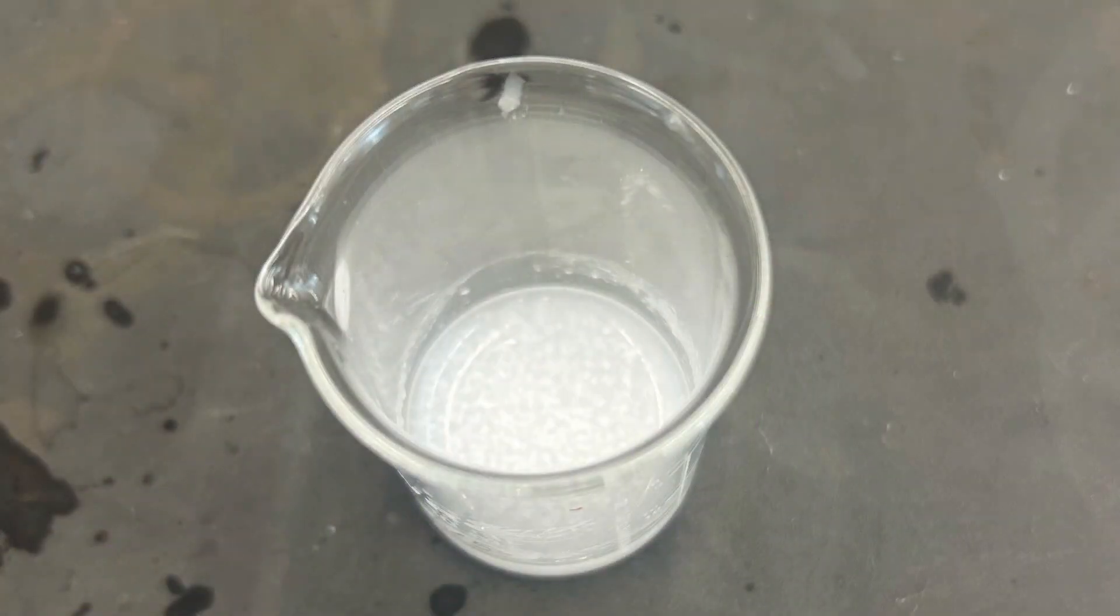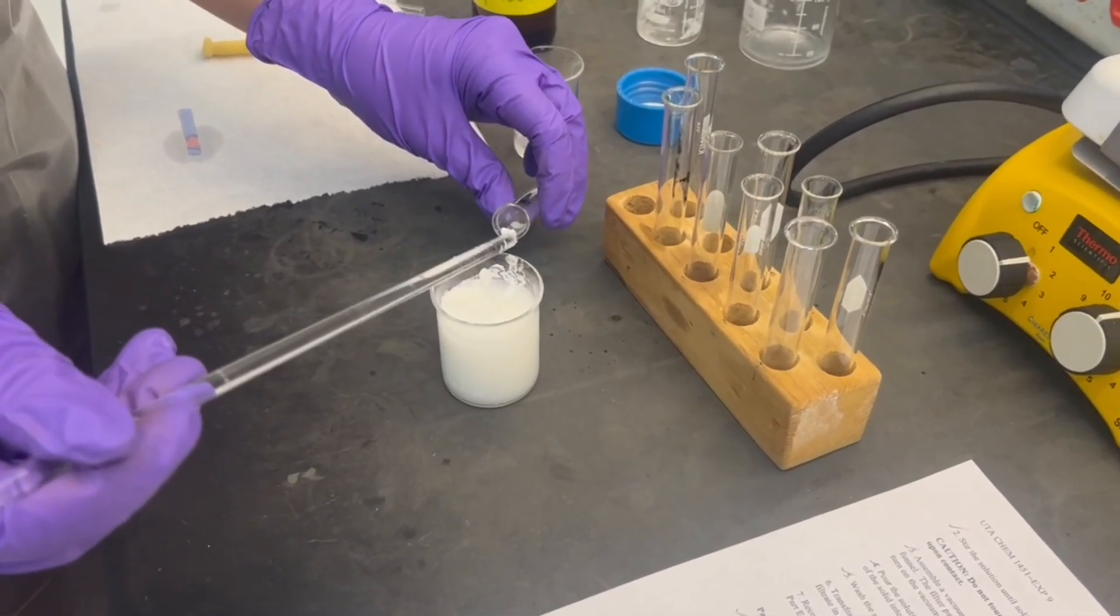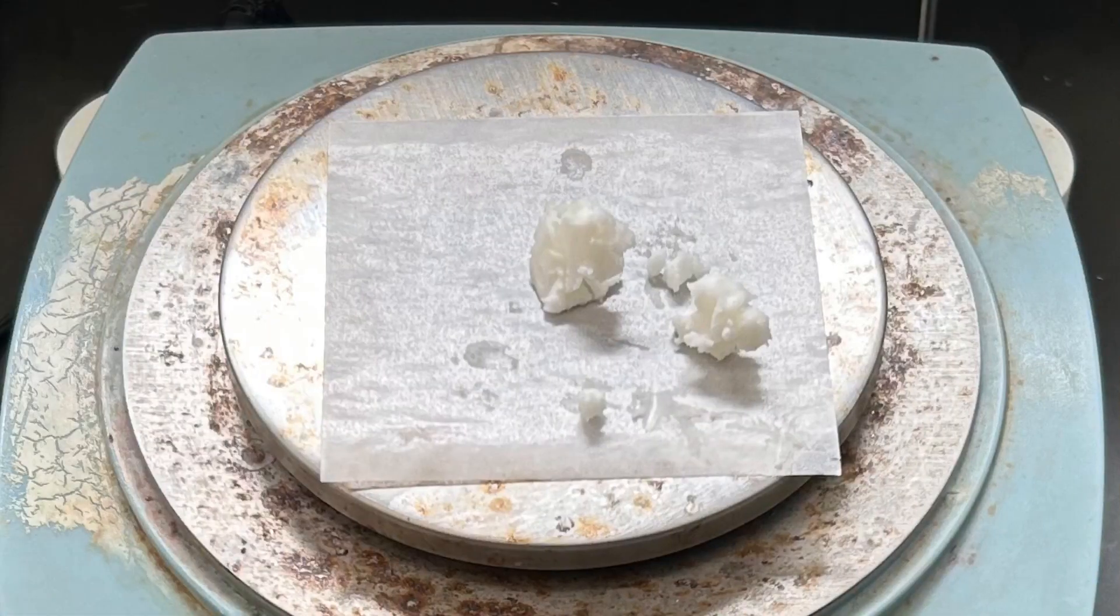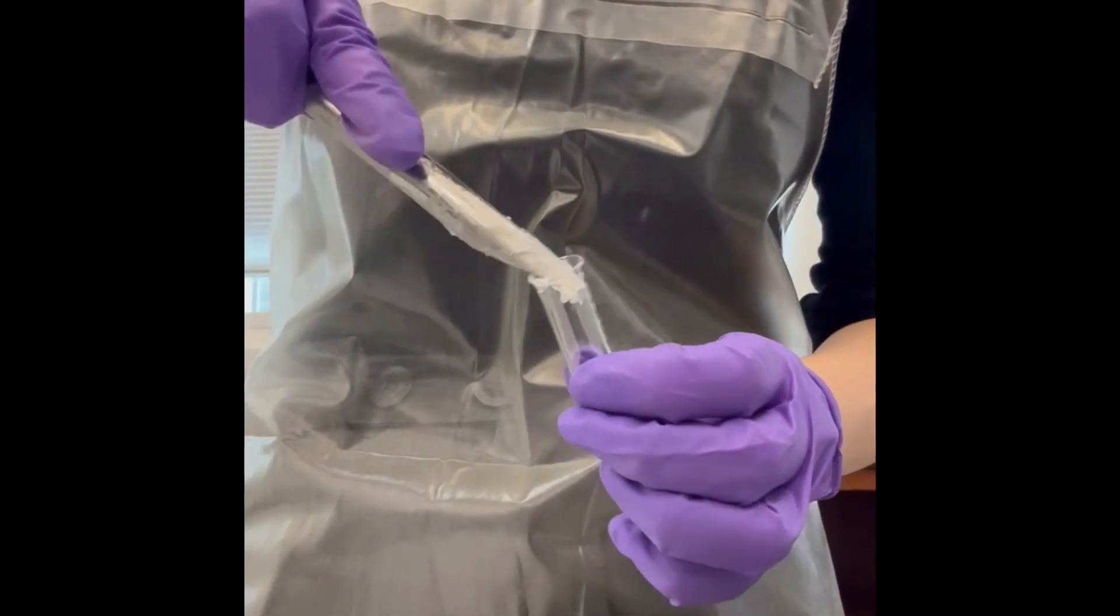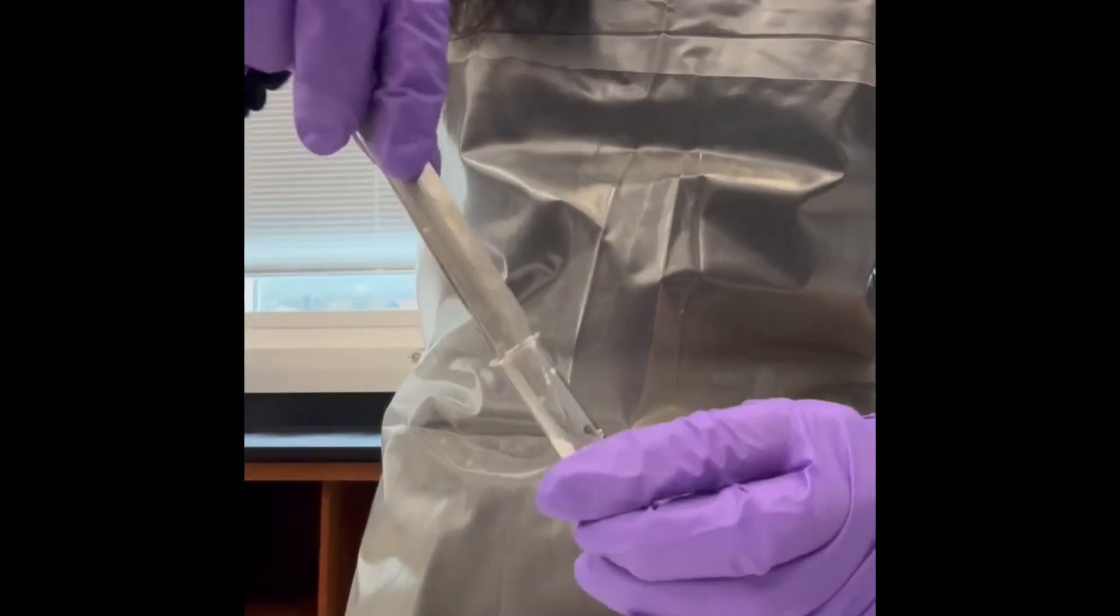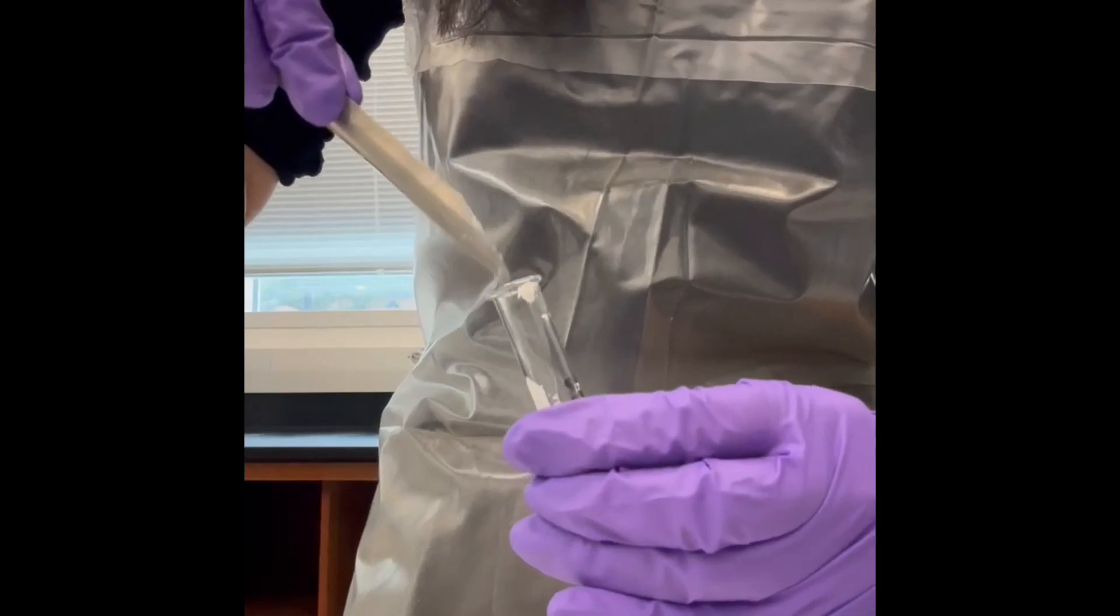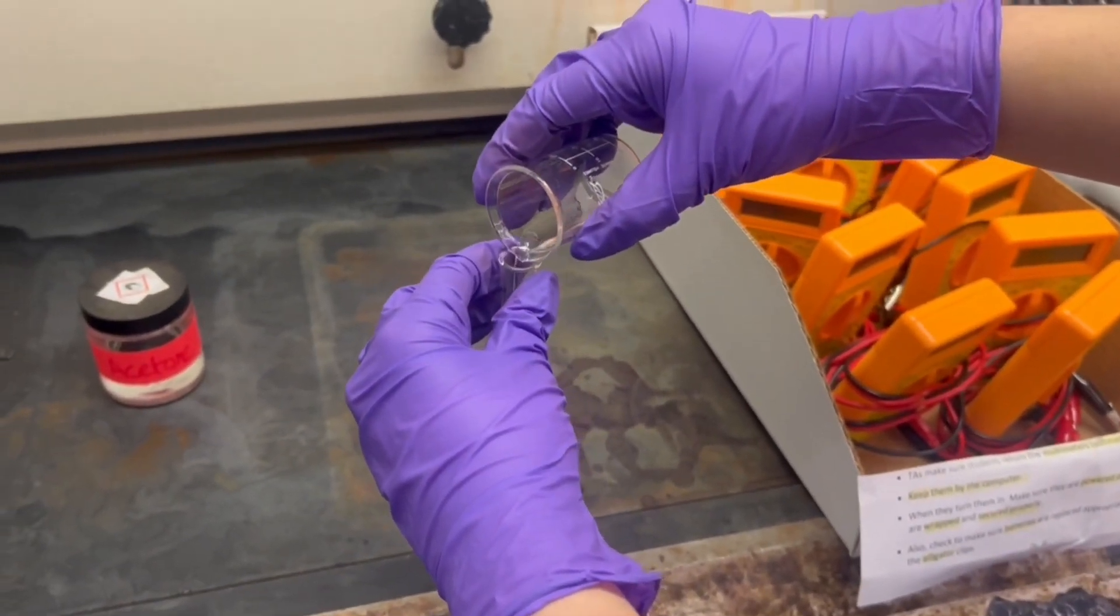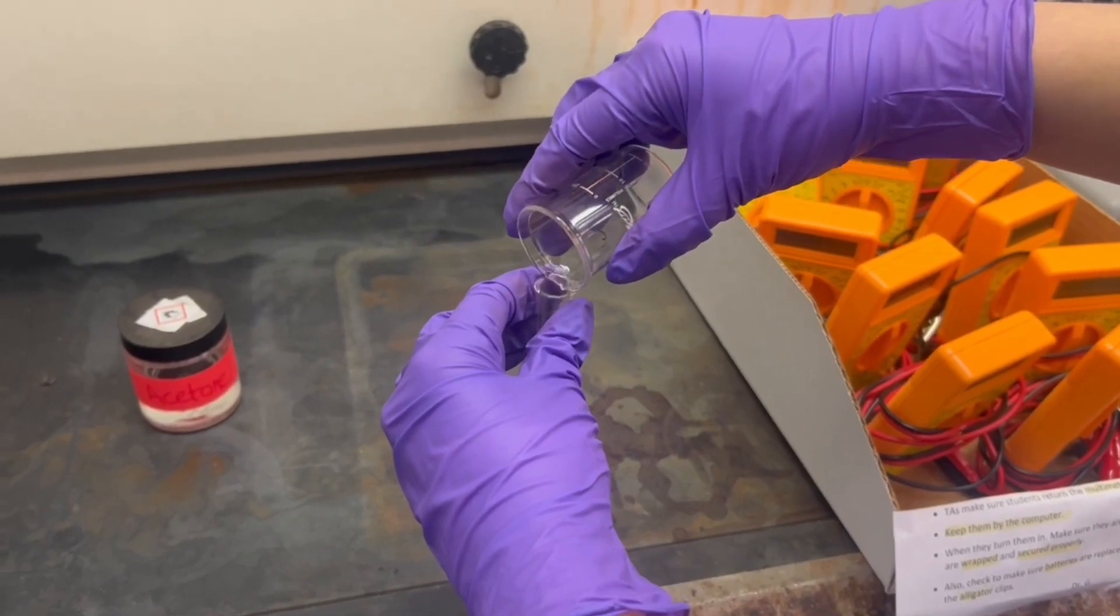Remove a small amount of fatty acid from the acidic solution and place it in the fatty acid tube. Add a small amount of the Crisco you used in Part B in the triglyceride tube and the sodium soap you prepared in Part C for the sodium soap tube. In the hood, add 5 milliliters of acetone to each test tube and record the solubility of each solid.